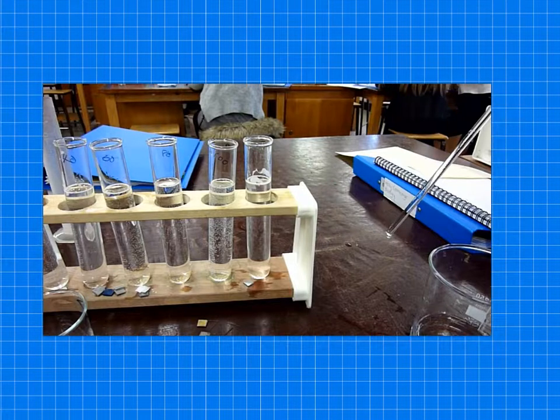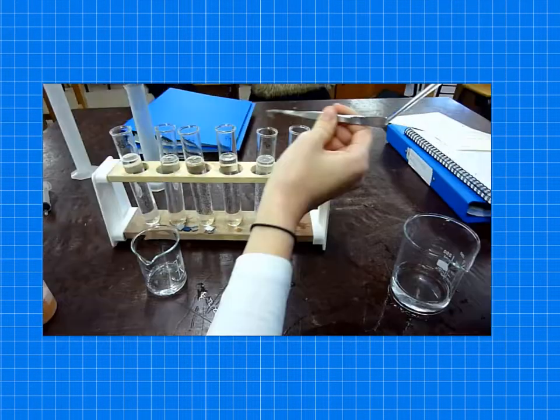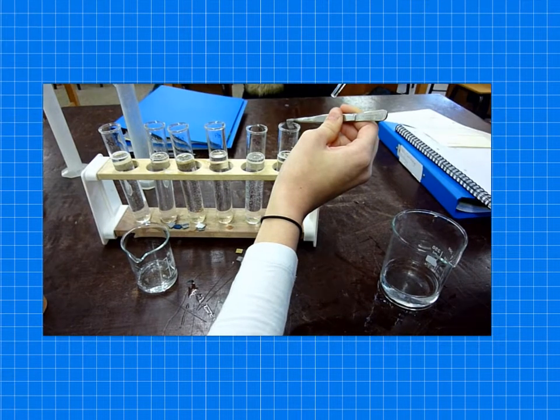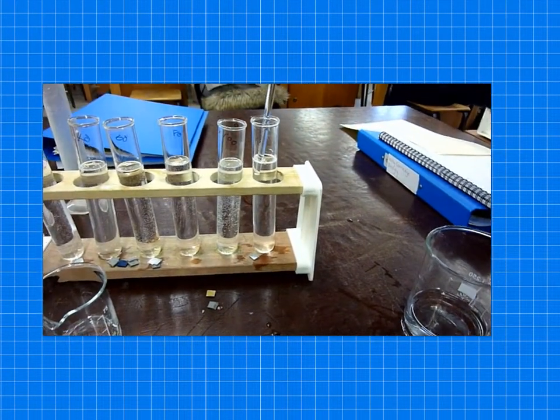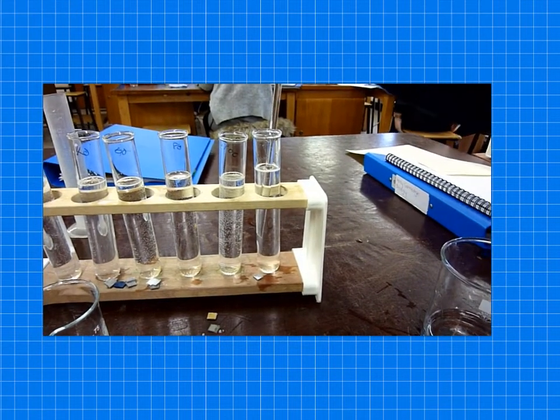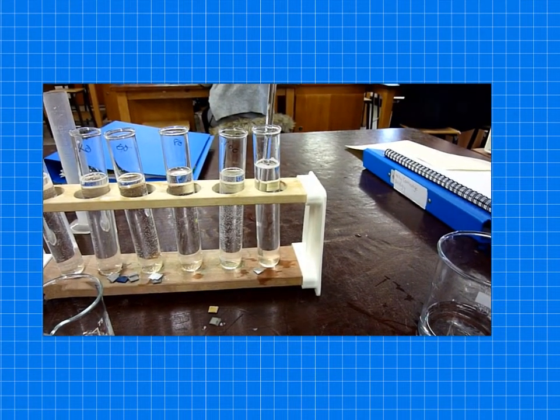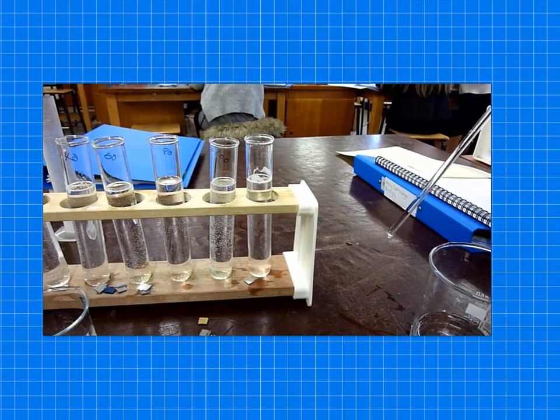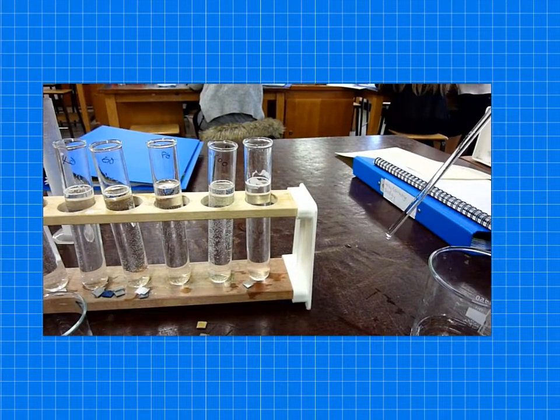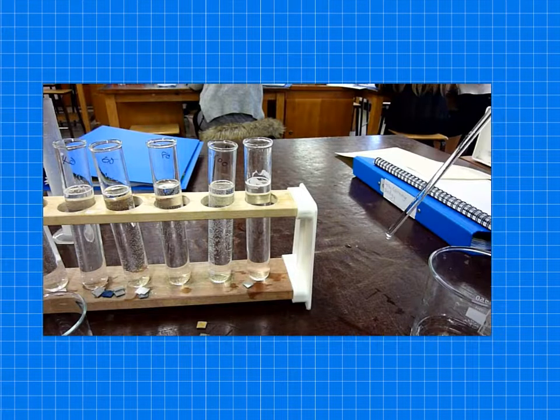Lastly, this one was at 5%. So much longer time. It takes much longer, the lower the concentration of hydrogen peroxide.